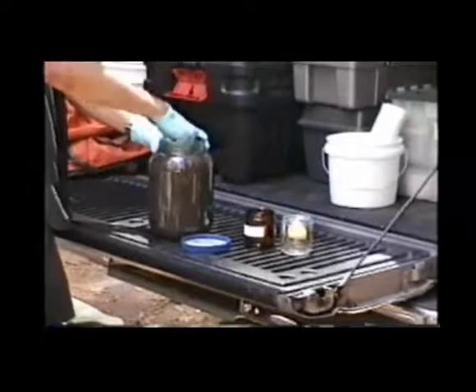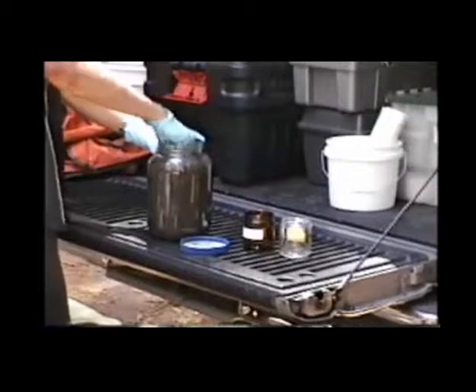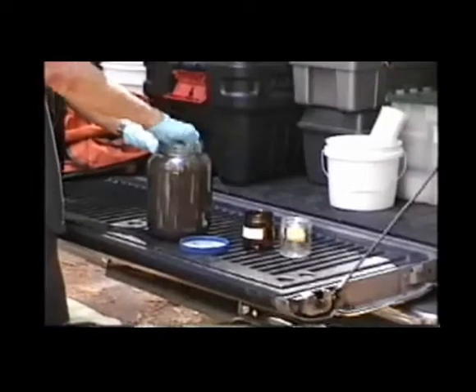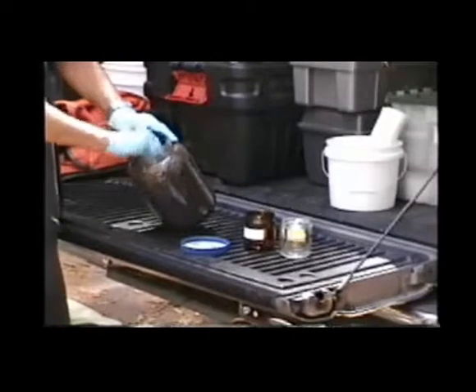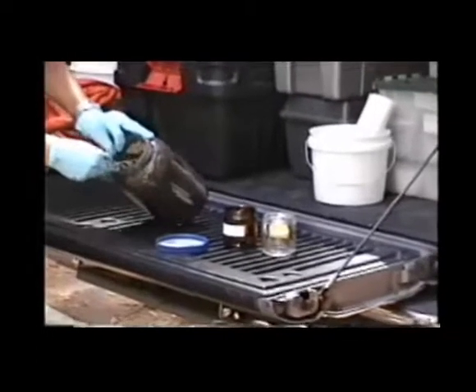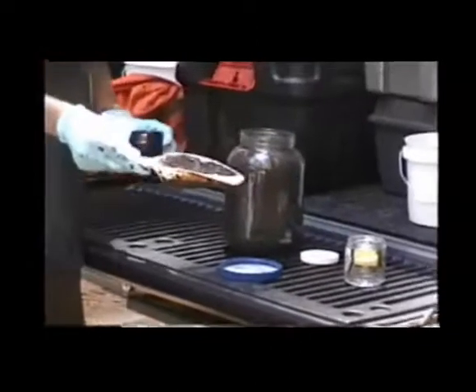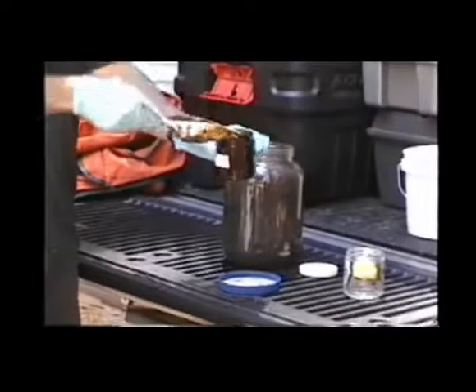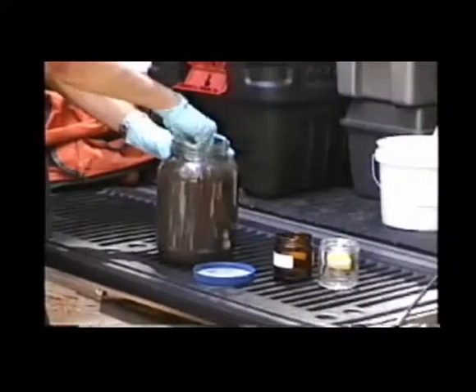And we'll aliquot in small increments to however many jars that we have. You never want to fill one jar up completely at one time and then move on to the next jar. The best strategy is to aliquot in small increments to every sample jar. As you can see, we have well mixed mud. I'll pour a small amount to the first one, stirring every time in between each aliquot.